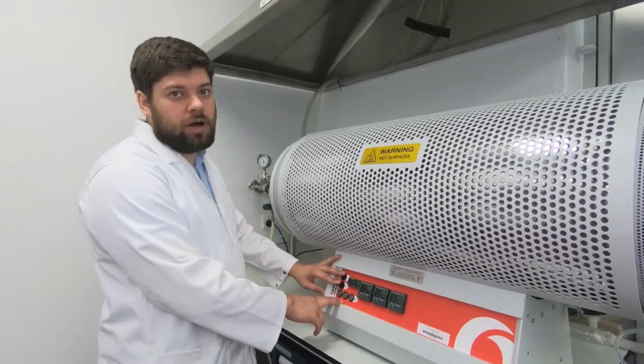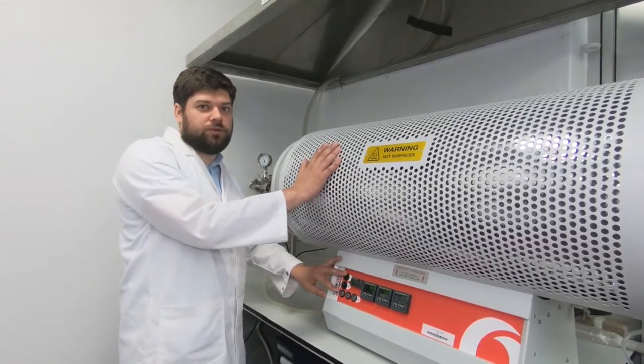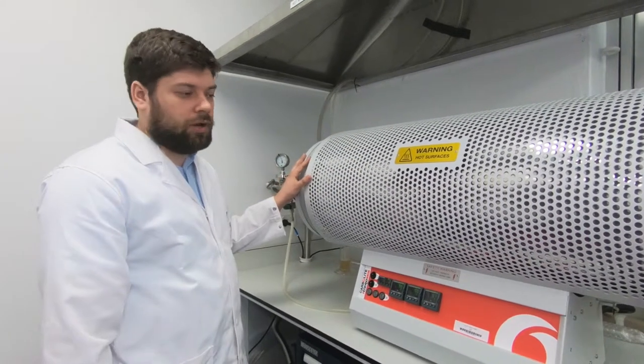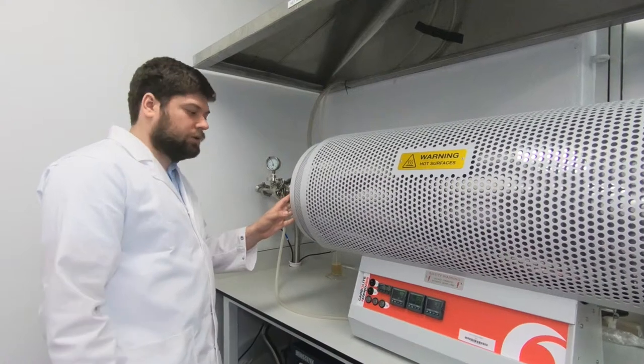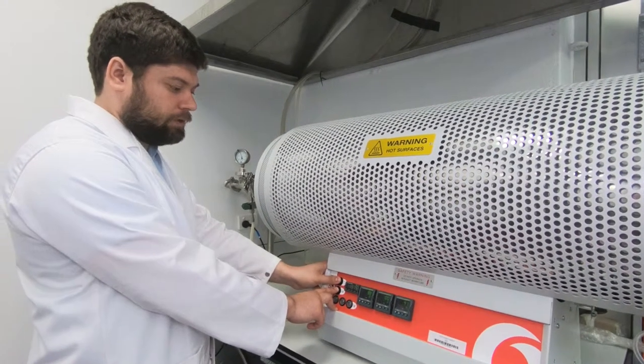Now when our powder was heated up to 1300 degrees and stayed at this temperature about one hour, and after this it was cooled down, the whole procedure took about 10 hours, we can turn off the furnace.